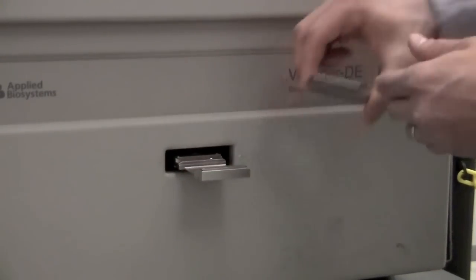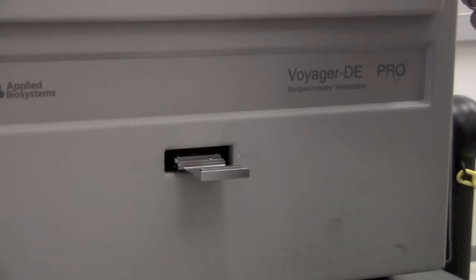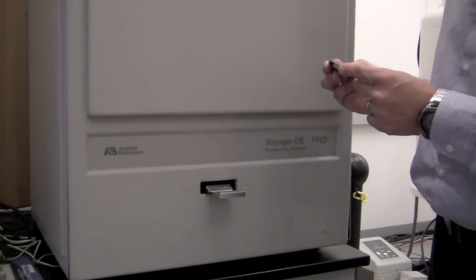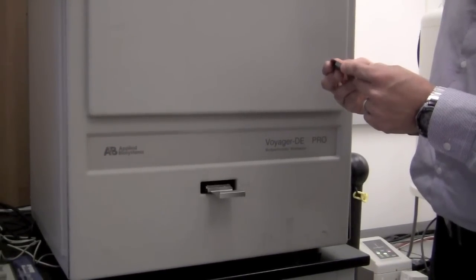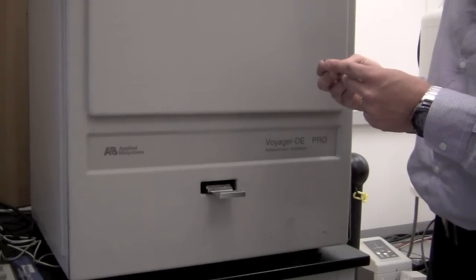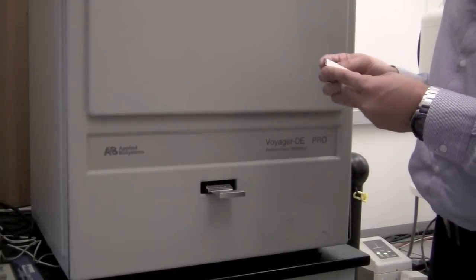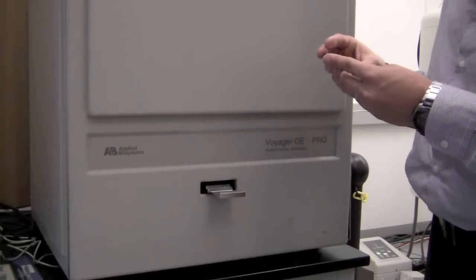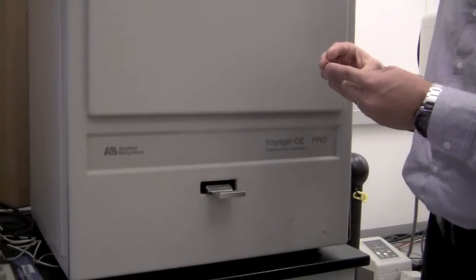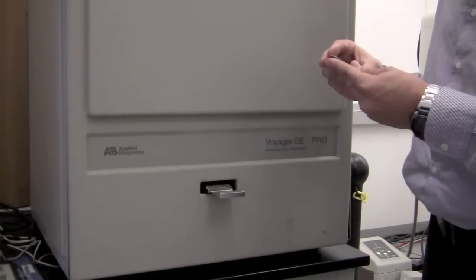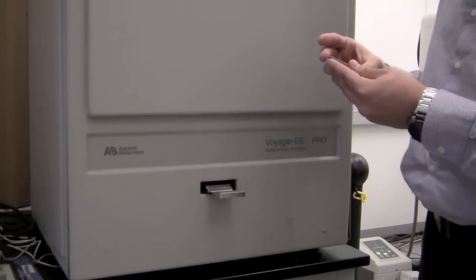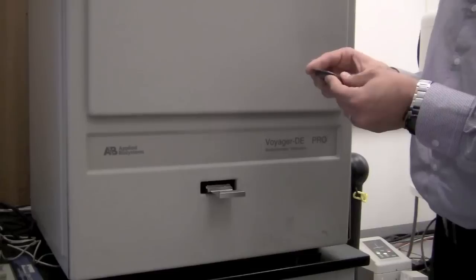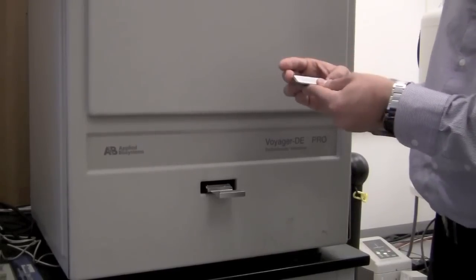Now regarding the sample plate, if you're going to run several samples, you should probably get your own plate to make sure it's not contaminated and make sure that it's available. We do have a couple of plates available in the Instrument Center that you can borrow, but typically you'll want to buy your own plate. Contact the Instrument Center staff for the part number. Also, the most critical thing for MALDI to get good data is your sample preparation. You'll need to use fresh matrix and to spot your sample with the matrix properly. You'll want to consult the literature for the best way to do that for your sample. In this case, we're going to assume that the sample is already ready to go, and it's already on the plate.